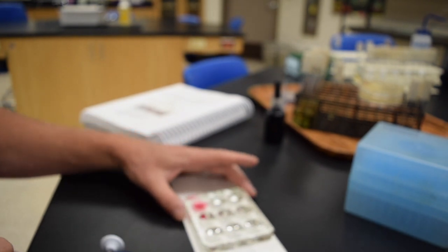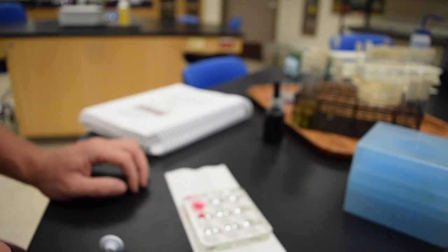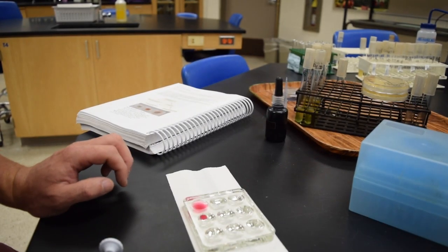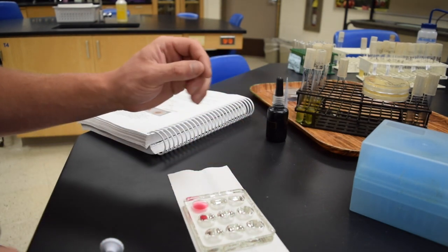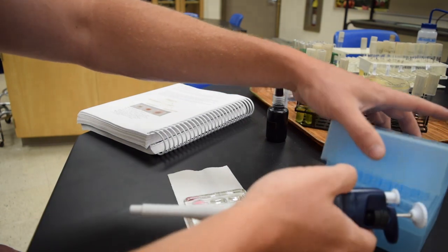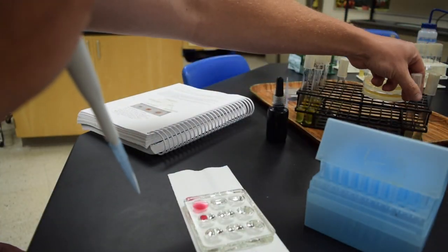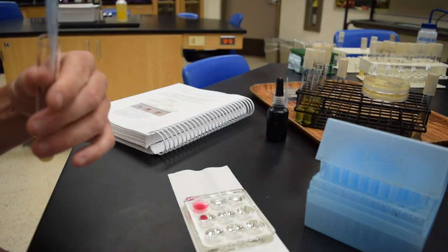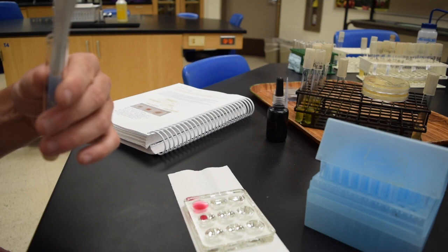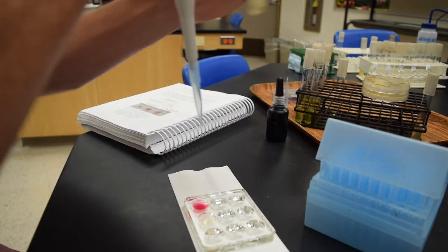The color change from clear to red indicates that the organism may or may not have used nitrate. You'll have to read the lab to determine. You do the analysis. Next, I will use Pseudomonas. One ml in that too, the little well there.